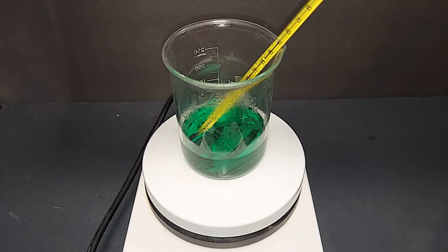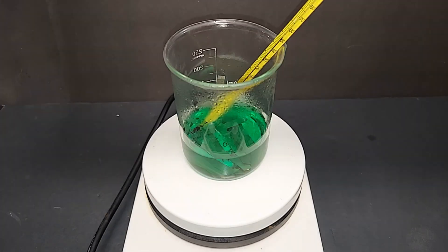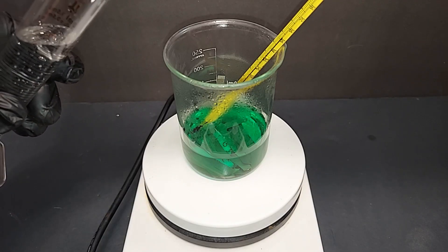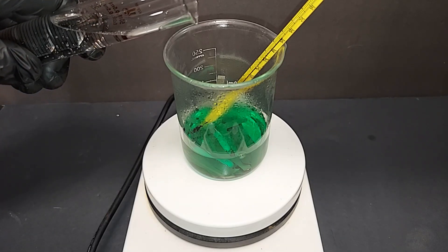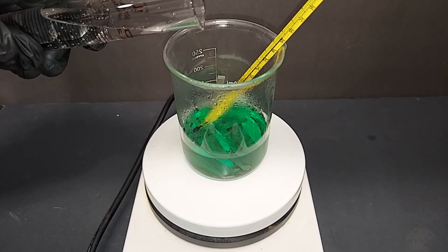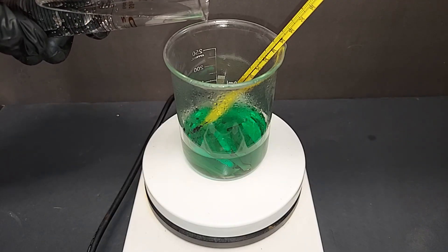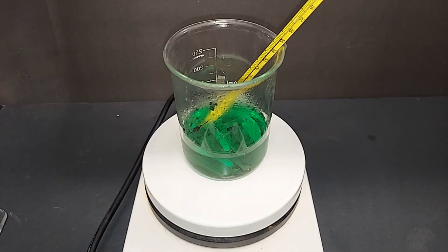It's been another 20 minutes and not a lot happened. The primary reason I added the hydrochloric acid was to balance out the fact that we're adding hydrogen peroxide to it, and I'm going to do that again. But I've moved up to 30%. I don't want too much additional fluid added to this because we need to get rid of it eventually. So that's why I'm increasing the concentration of the hydrogen peroxide, which you have to be very careful with these percentages, rather than add a bunch of 20% and needing to get rid of the water. I can add less 30%. Okay, that's about 5 cc's.